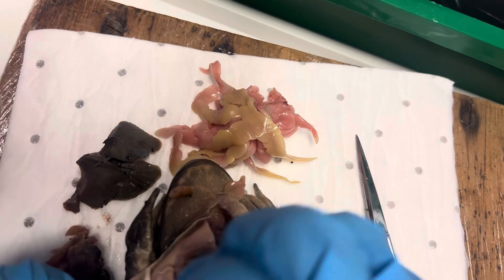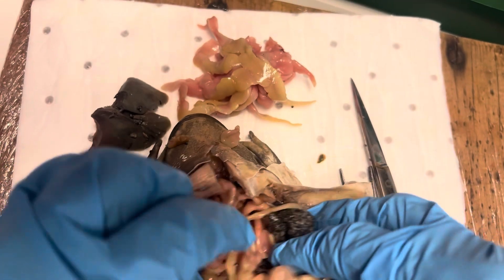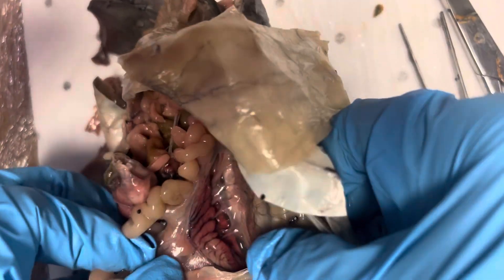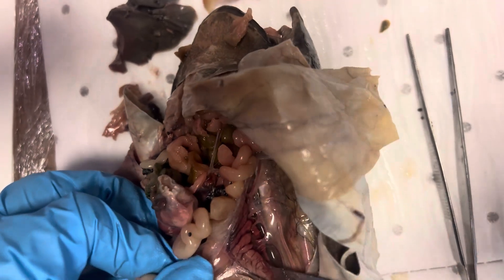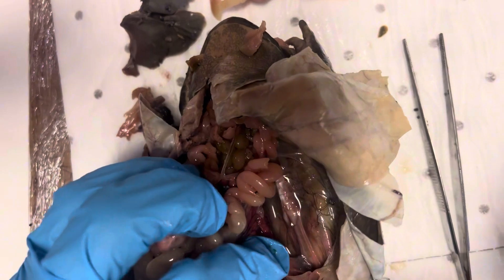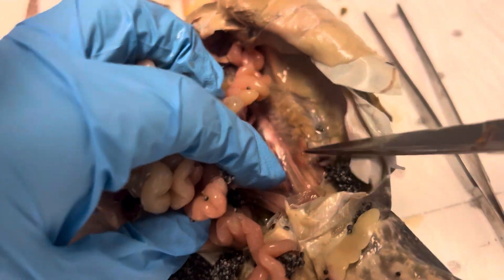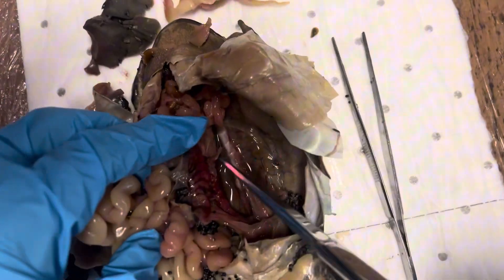Generally you should be able to find the kidneys around at the back. There's more fat bodies there, and there's a huge amount of gut — that's massive. You should be able to see the kidneys at the back — you can see the spinal cord there. You can see the gut going down to the anus, all the cloaca down here. I can't quite see the kidneys, but there they are — kidneys.